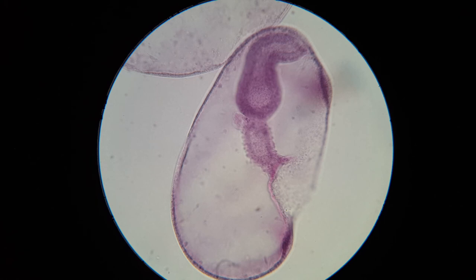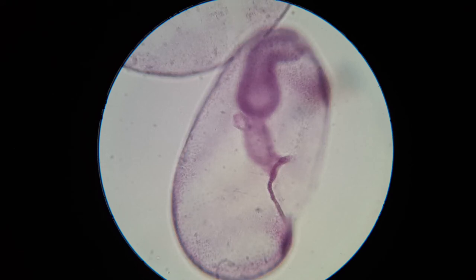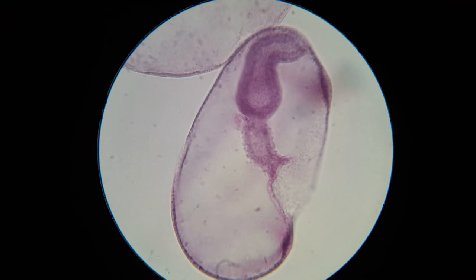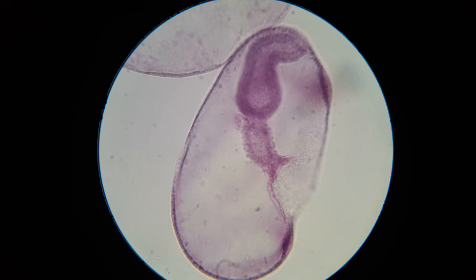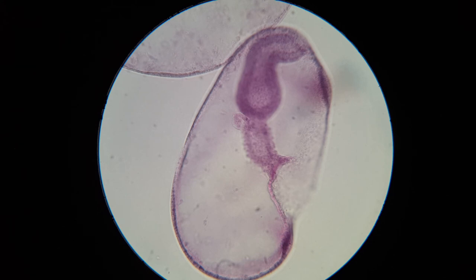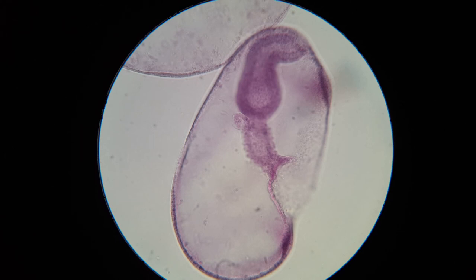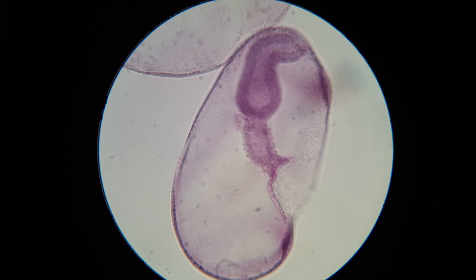This slide is called Starfish Early Bipinnaria. These are larvae — they already have a complete gut with both a mouth and an anus. Focusing in on various parts of the larva, you can see that we're looking at something with more than one opening to its gut. One opening is on the top and the other is on the right-hand side. Starfish bipinnaria larvae are already free-living organisms — no longer embryos, not yet adults, but on their way. You'll notice there's no sign of five arms. Starfish are bilaterally symmetrical as larvae, and the radial symmetry with five arms is only seen in adults.